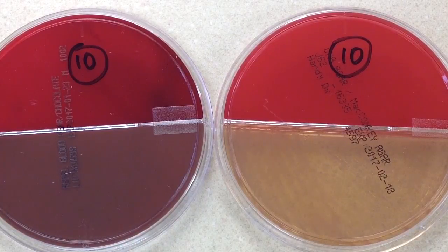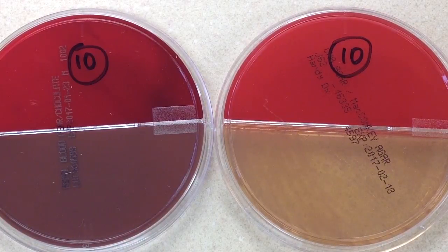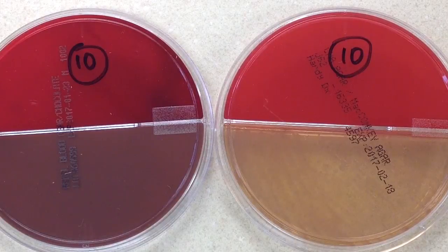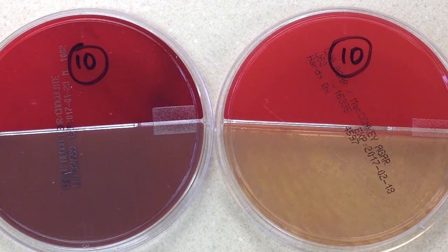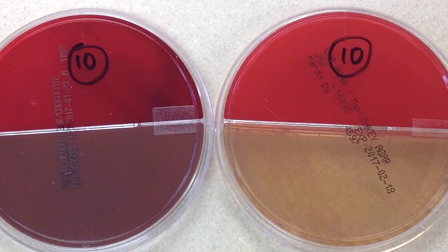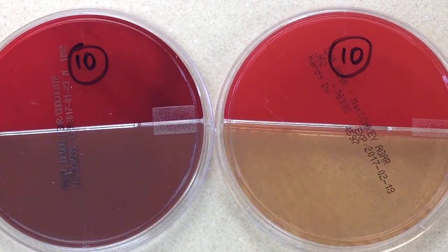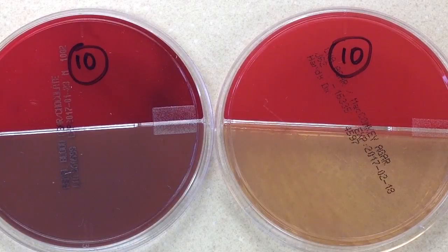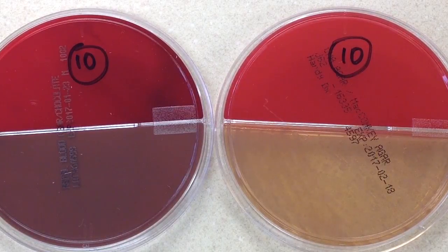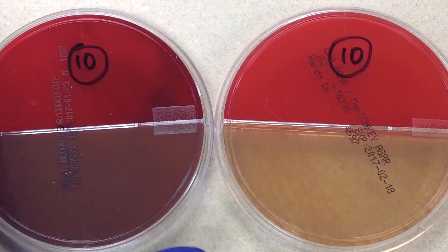When we looked at the slide, it had a lot of PMNs, meaning it's an acceptable specimen, so we can move forward with the culture. If it were a bad specimen, it may be rejected and recollected. Another purpose of the direct smear is to give the physician an idea of what's going on — for example, pleomorphic gram-negative rods are quite different from gram-positive diplococci or lancet-shaped gram-positive cocci in pairs.